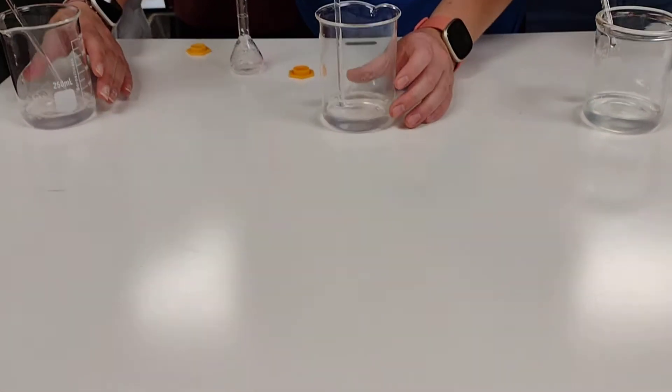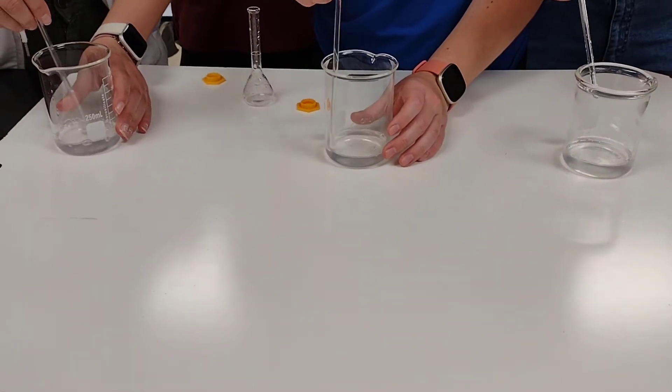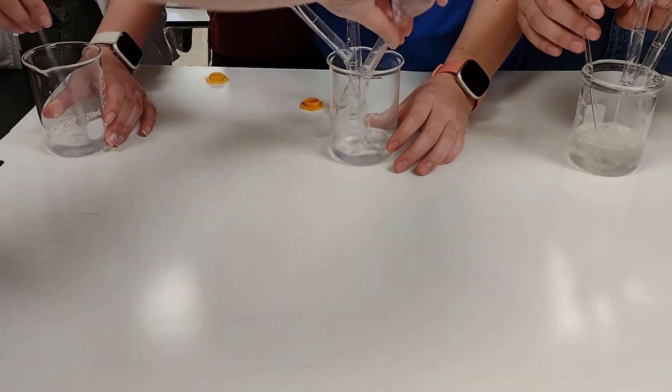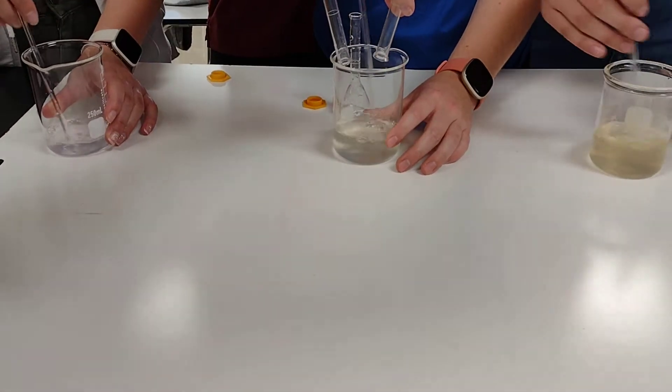All right, when you guys are ready, dump in one and two together and stir. A yellow color is a good start.